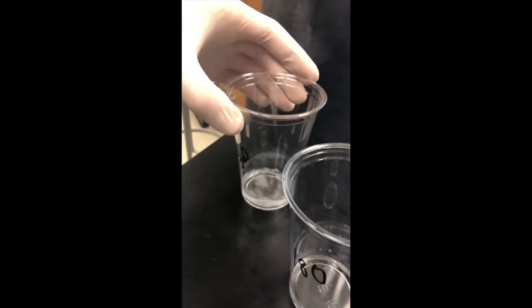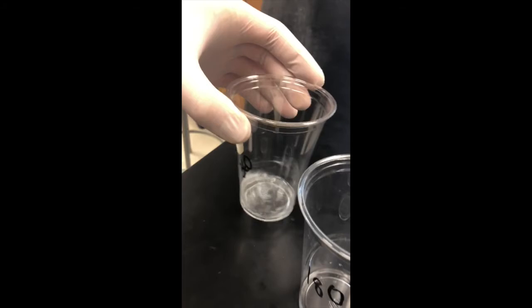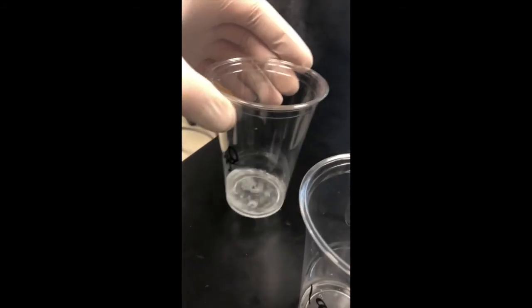This was probably the greatest source of error due to the fact that we noticed the drops of KMnO4 coming out of the syringe changed sizes over the course of the experiment. Although we were able to determine that 1 milliliter of KMnO4 equals 23 drops, this number is just an average and could have led to flaws in the data collected.